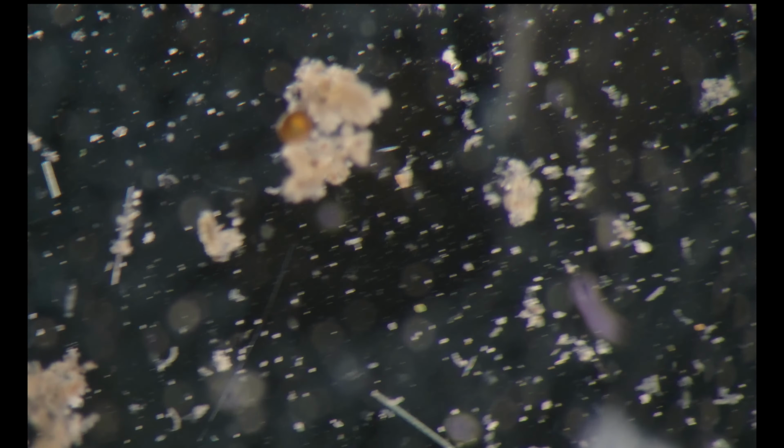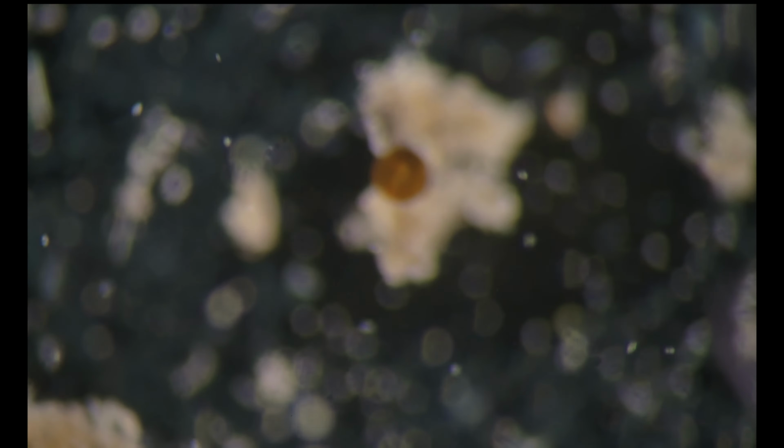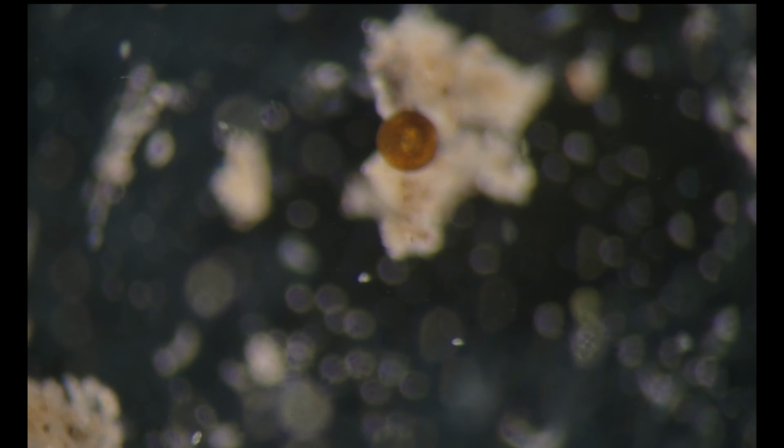We'll do it more methodically. Yeah. Here is the Arcella. You know what?